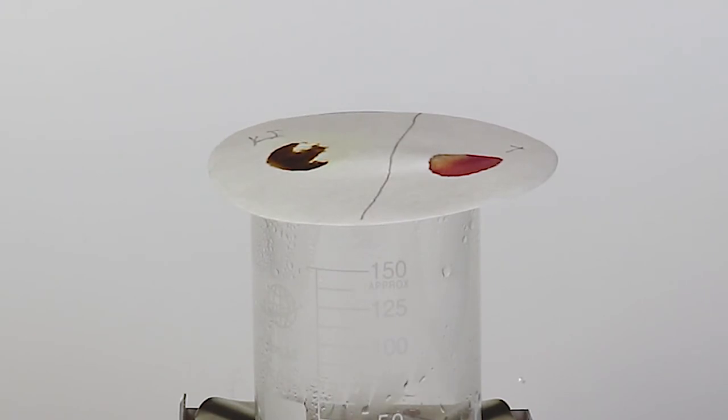However, that's not the end of the transformation in this experiment. You will notice that this stain slowly loses its color.